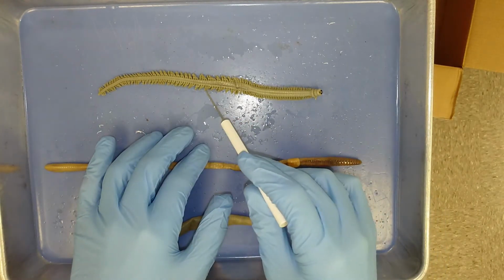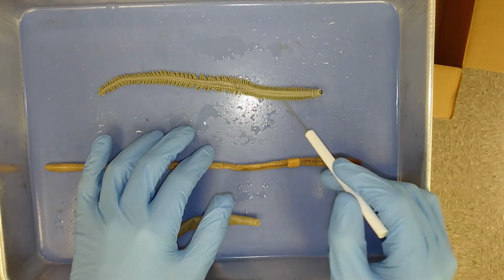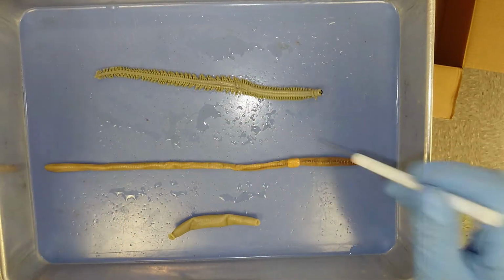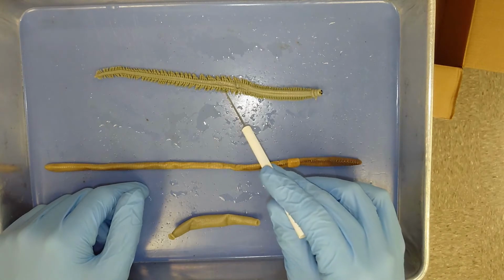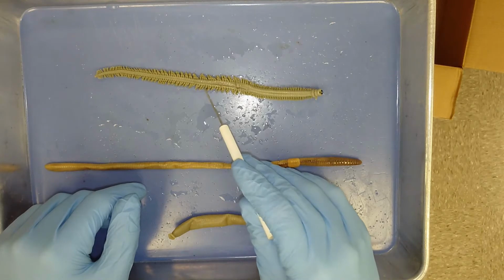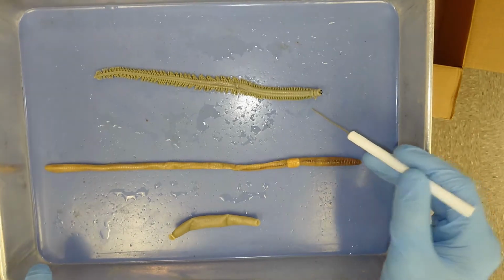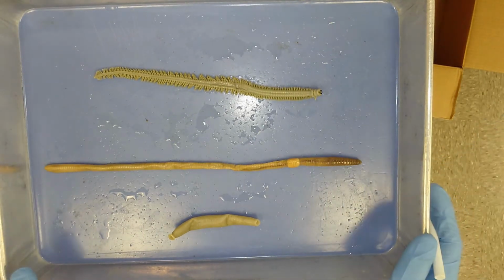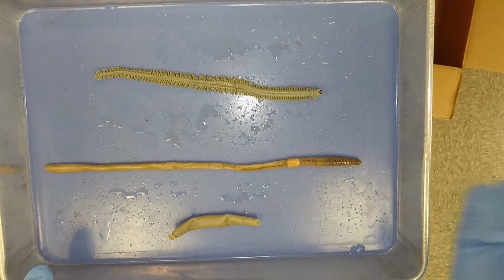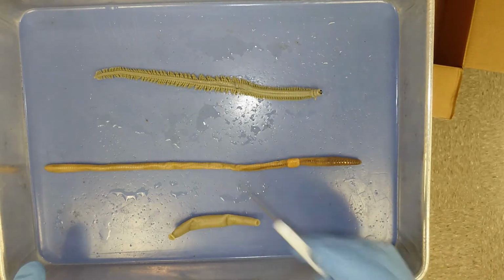They also have what's called parapodia, or these fleshy appendages that look kind of like arms that run down the length of the body. These appendages aid in locomotion, so it can help this organism swim, or it can help it crawl through the sediment if it lives in a benthic environment. These parapodia also increase the surface area of the body, and so when these organisms are living in anoxic environments or environments with low amounts of oxygen, they can use that increased surface area to diffuse more oxygen into their bodies. So it's a dual functioning appendage right there.